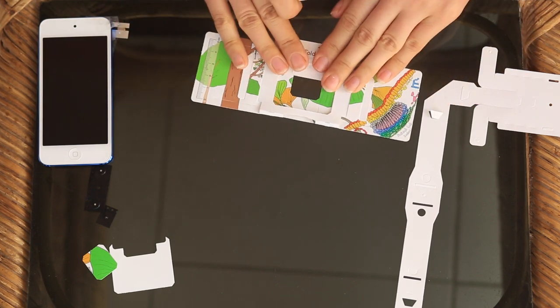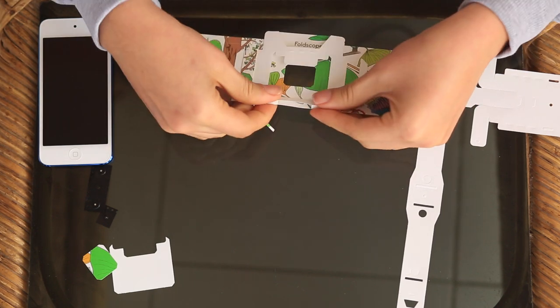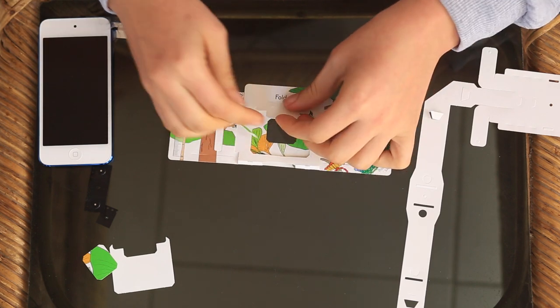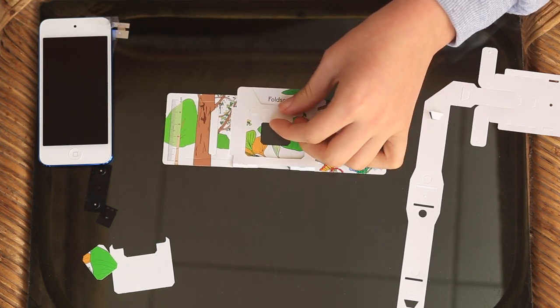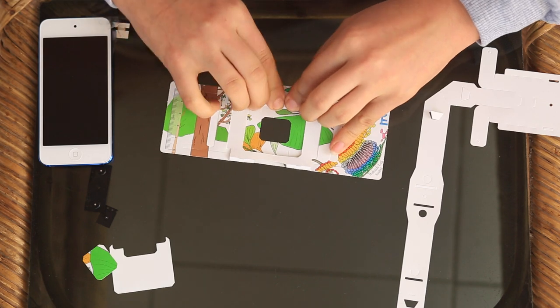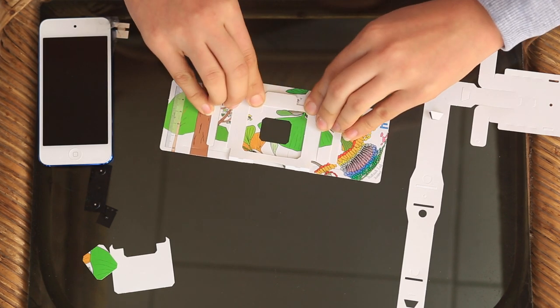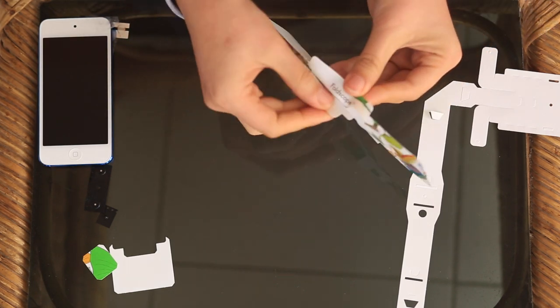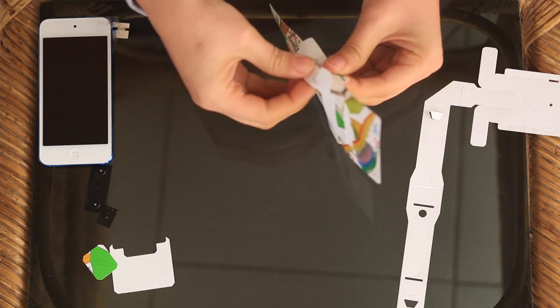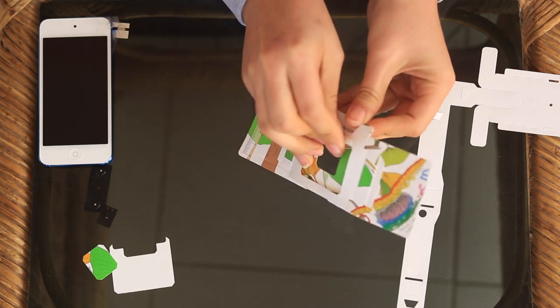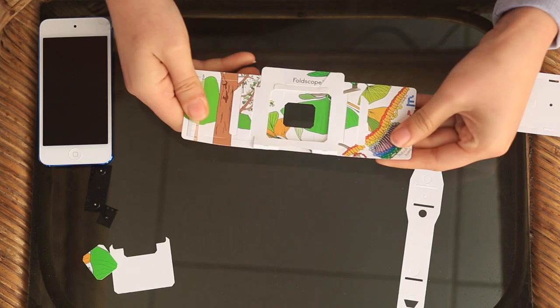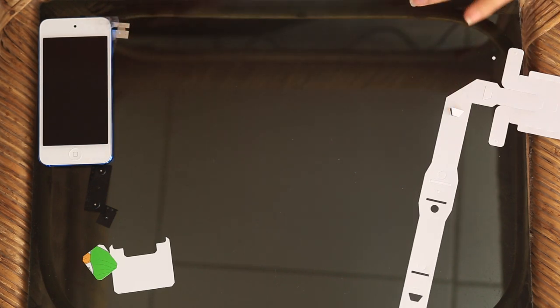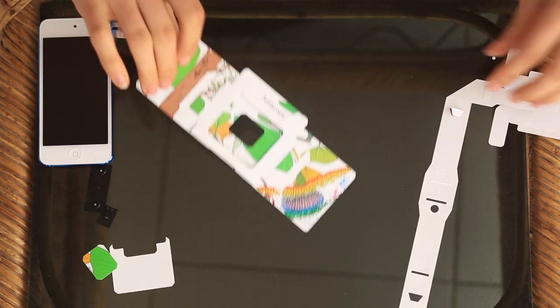And you want to make sure everything lies flat. And that goes like that. Then you fold this flap upwards and slip it into this fold that's right behind the Foldscope logo. So that's the completed part of the butterfly or the panning stage.